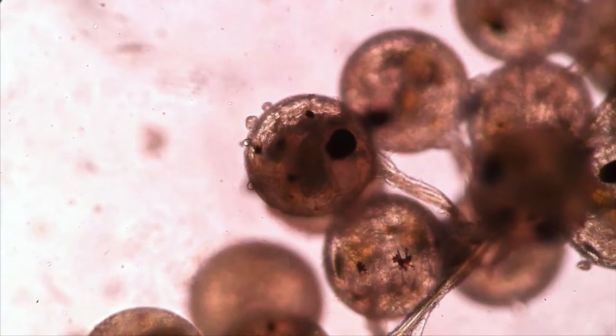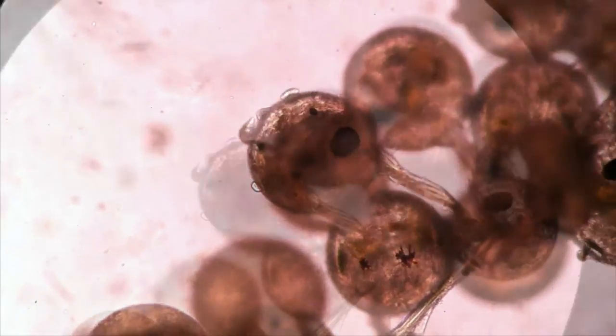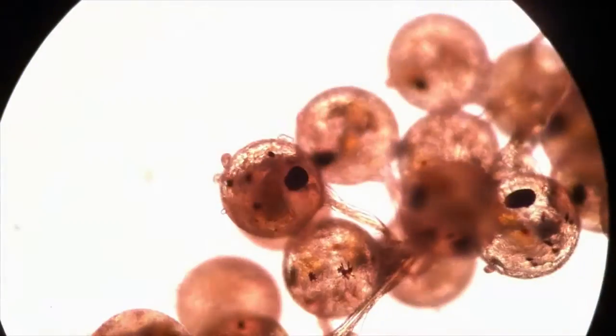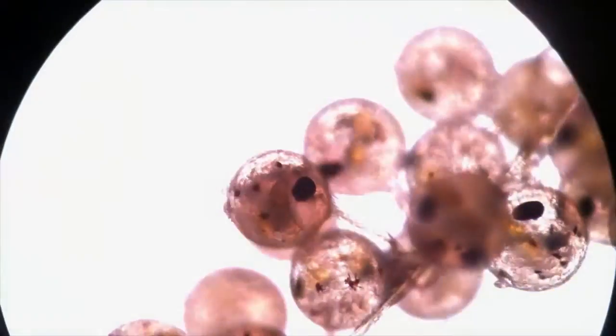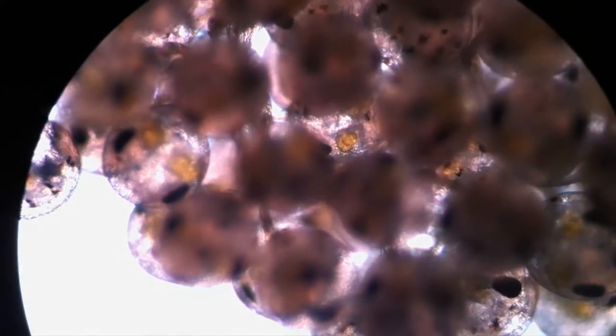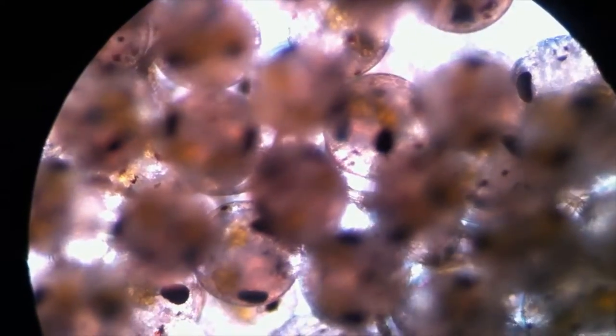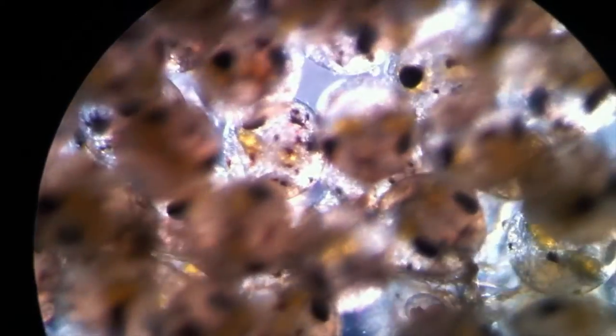I see crabs all the time when I'm out scuba diving. And when they're gravid — meaning they have eggs — the crabs usually hold them underneath a little bony plate called a telson, and they look kind of feathery. Well, this is what the crab eggs look like underneath a microscope.